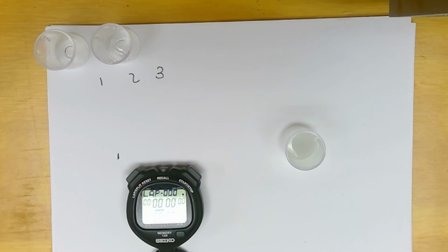That wasn't very good. Oh well, 55.1. Okay, so that's my first 2 trials in my data table 1. Now I'm going to clean up and we're going to get set for data table number 2. So I'm going to pause you.